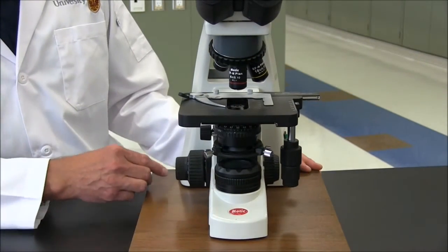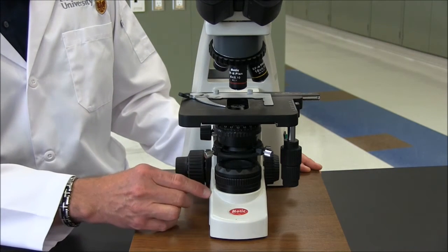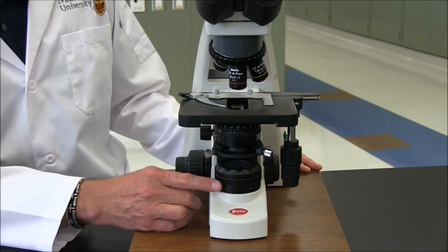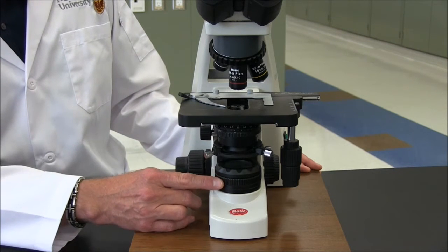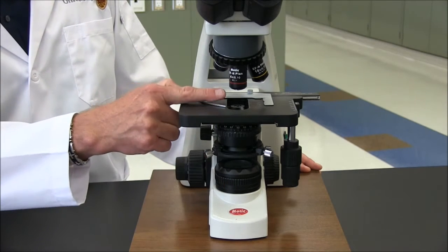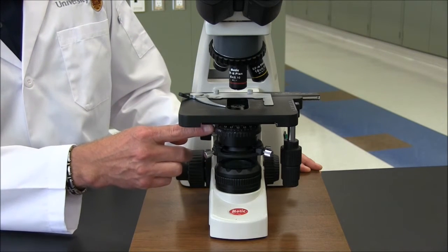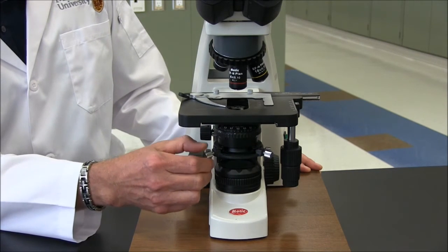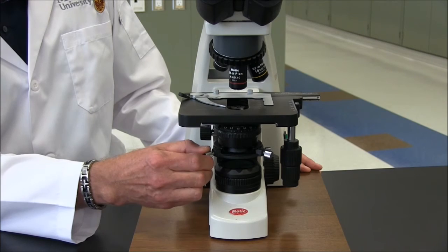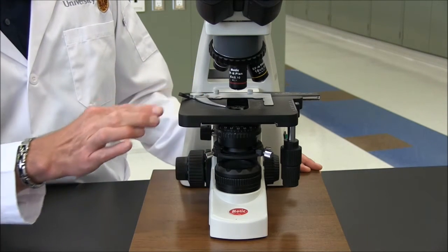The light from the halogen lamp travels from the back of the microscope to the front of the microscope and through the field diaphragm located here. The ring around the diaphragm controls the diameter of the light that travels up into the objectives. From here, the light travels through the condenser. As we mentioned, this knob controls the height of the condenser, while these set screws control the centering of the condenser so that it lines up perfectly with the objective.